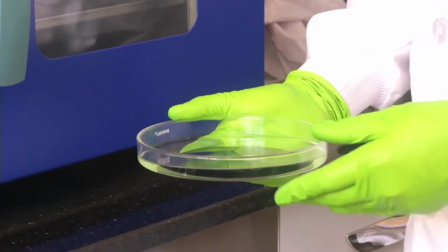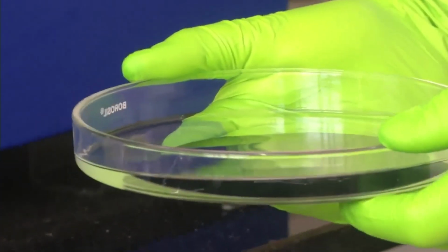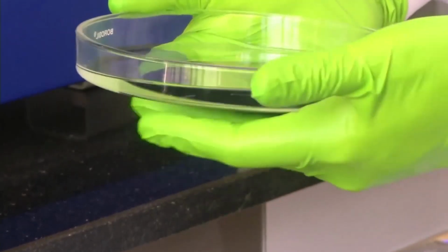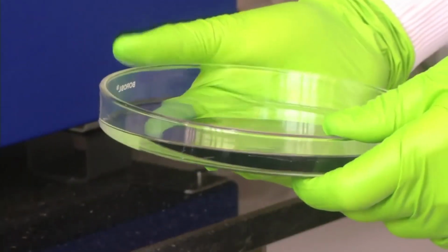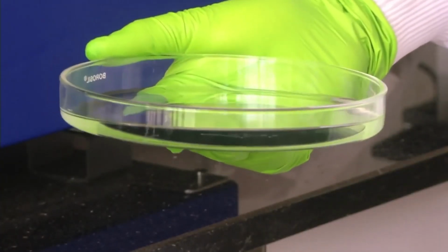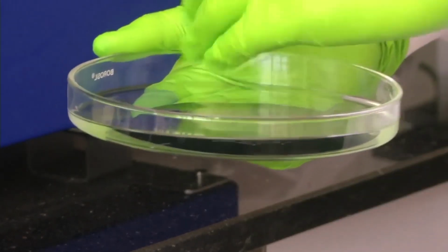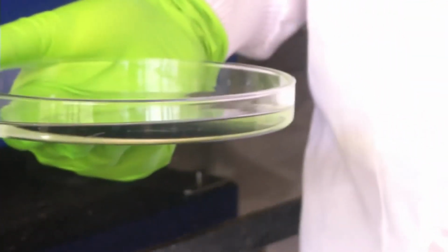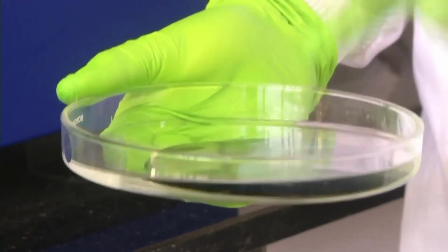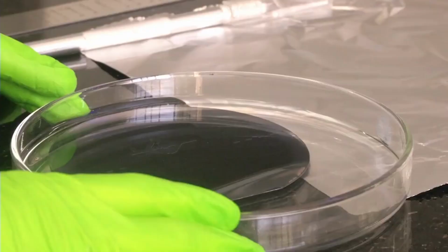You might not be able to see because the PDMS has formed a very clear surface on top of the mold. It is almost like glass and you are not able to distinguish which is the petri dish bottom surface and which is the PDMS surface. Now the next step is to cut out the PDMS membrane with the pattern with the required size that we need, and the remaining area also has PDMS which we can cut out to see how PDMS has formed. So first we will cut out from a normal area which is not under the mold pattern and show you how PDMS looks after curing.